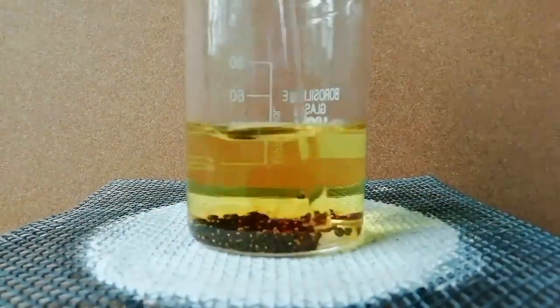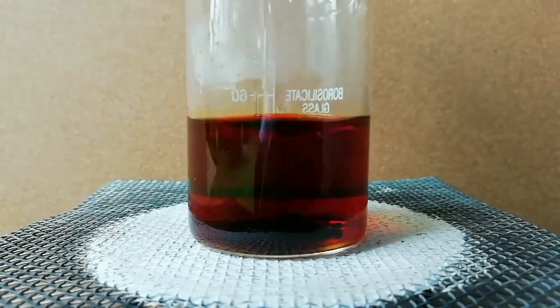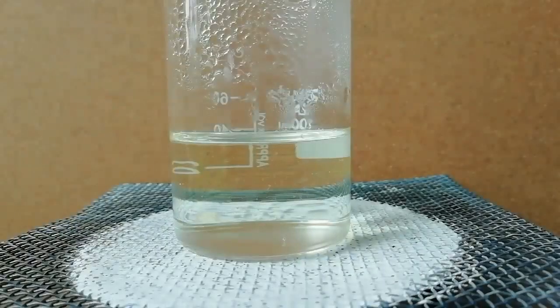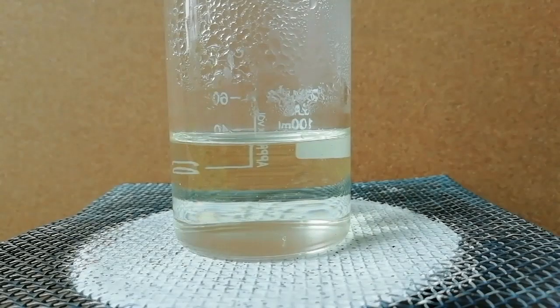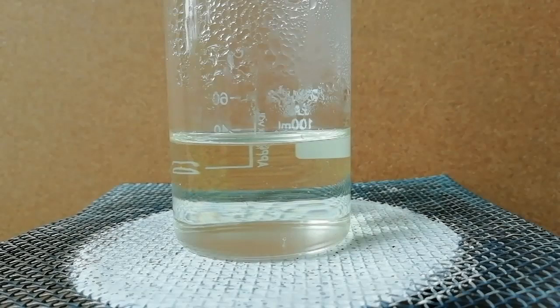In my case, potassium hydroxide was not enough for the reaction because of the impurity in potassium hydroxide, so I decided to add more pellets of potassium hydroxide. After adding potassium hydroxide again, the solution went colorless slowly.